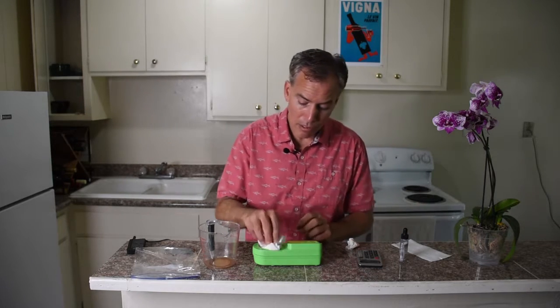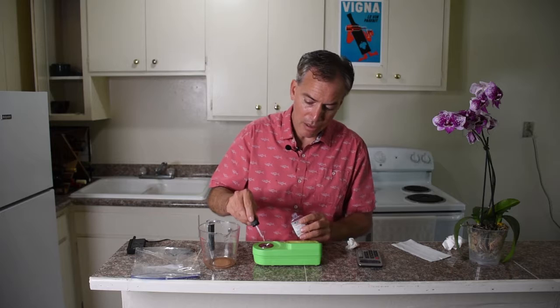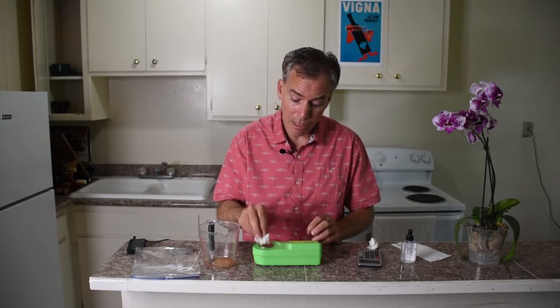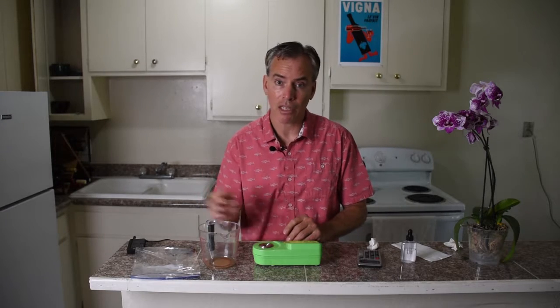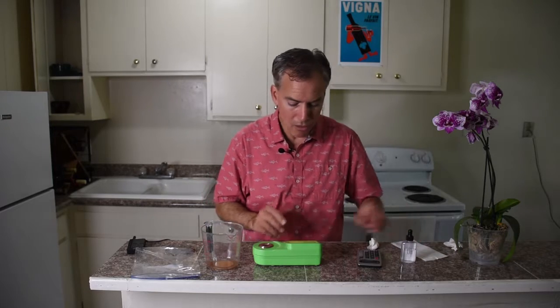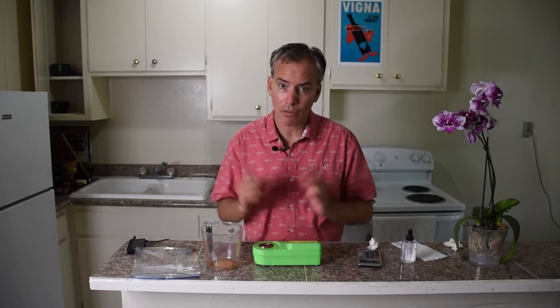Typically what you want to do is get an average of a couple different readings to give you an idea of when you want to get your pick set up. Because in today's world, it's really difficult to find the labor to pick. Usually you're working with a farming company and those folks are well booked up, just like airlines. So you need to allow yourself enough time to approximate when your grapes are going to be optimally ready. Let's do one last third reading — and we are at 20. So we're right in the range.